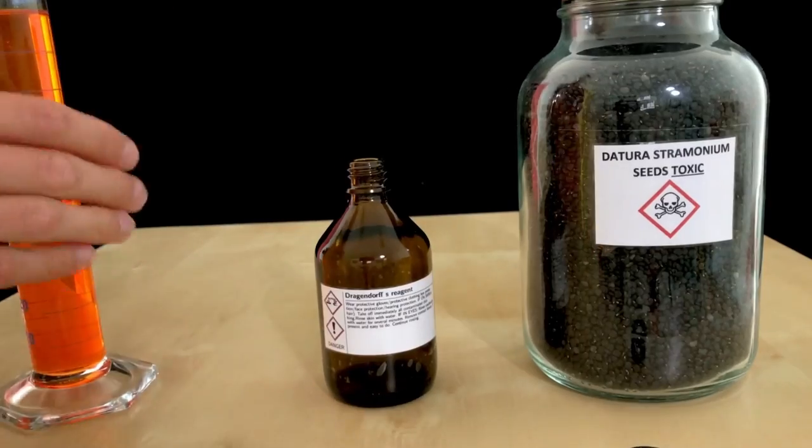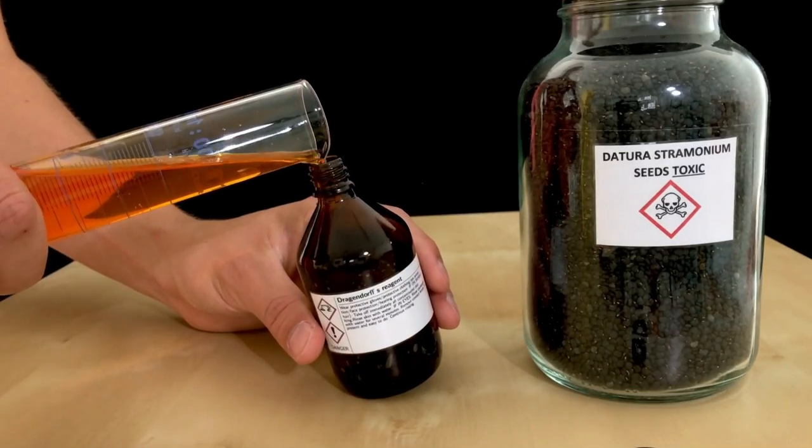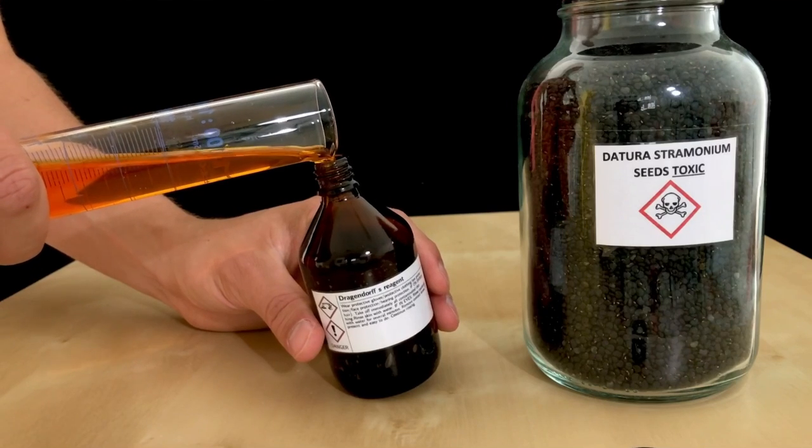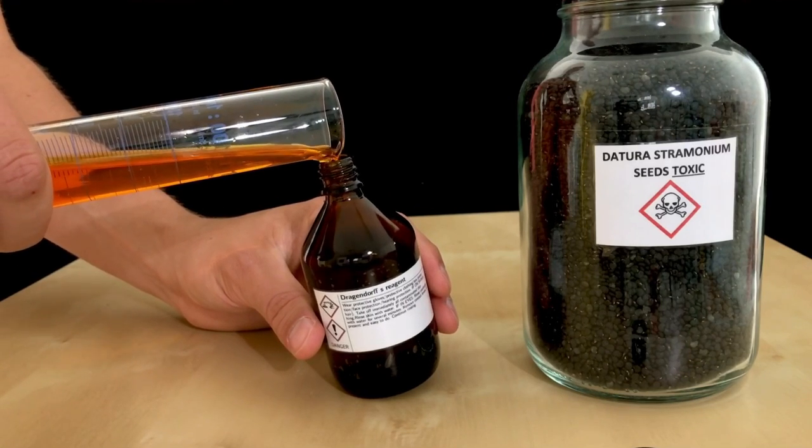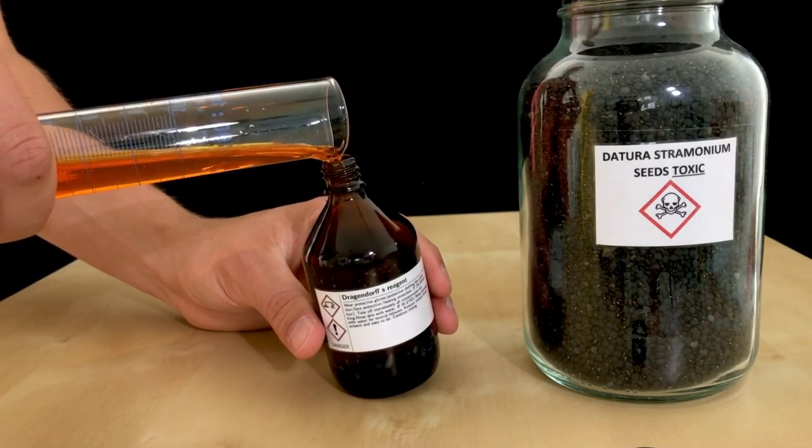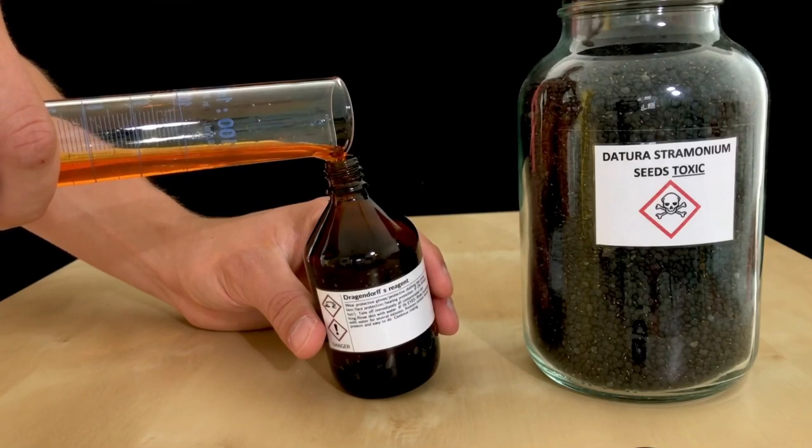As you can see I am not wearing gloves while doing this experiment and if you repeat this you definitely should wear some. I however made sure not to spill any of this onto my hands and as you can see I am still alive.